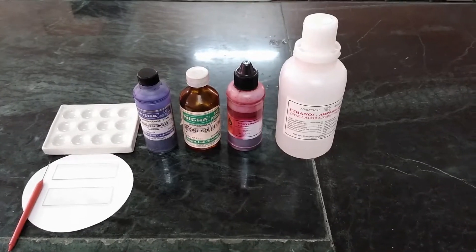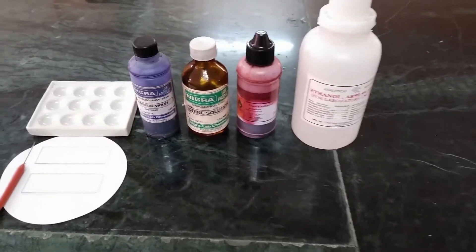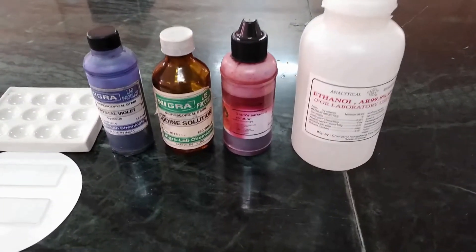The reagents used for the study are crystal violet, gram iodine, safranine, and ethyl alcohol.